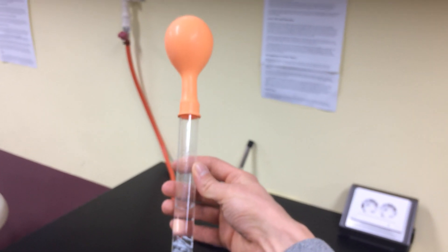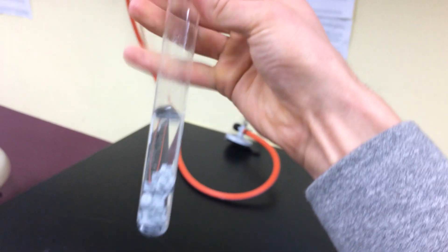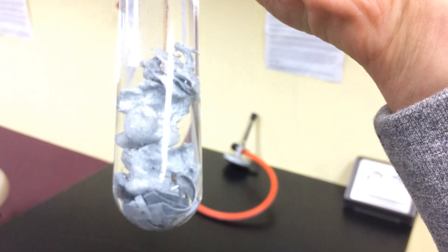And I have put a balloon on the top, and you can see the balloon is filled with gas and the gas is coming off the reaction. The gas is hydrogen gas, H2.